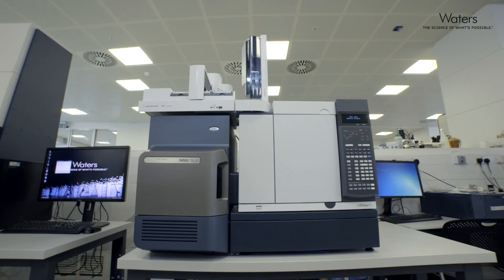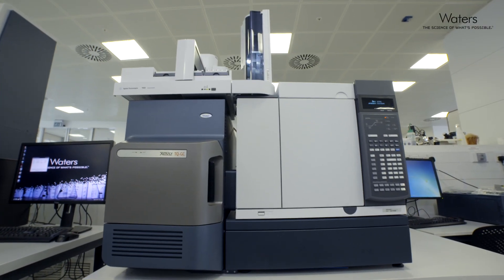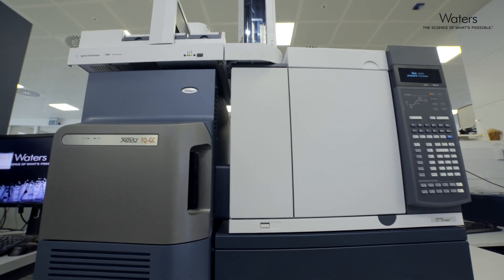Waters strives to understand these problems and determine how our technology and workflow solutions can address them, helping to reduce business risks and make laboratories more productive. And that's why we've created a new addition to our Xevo family.